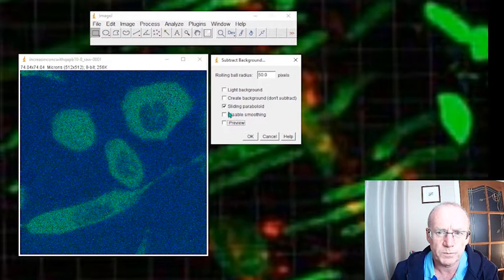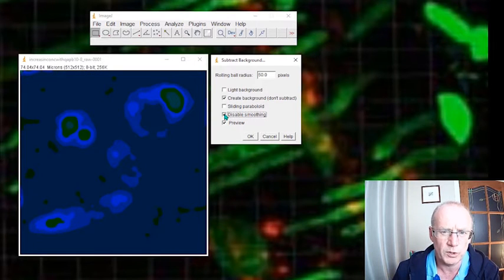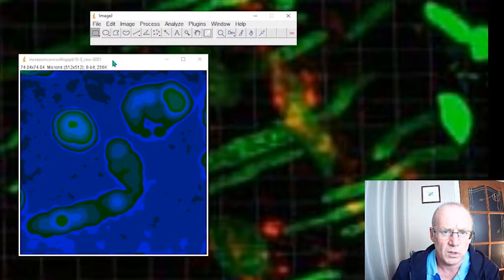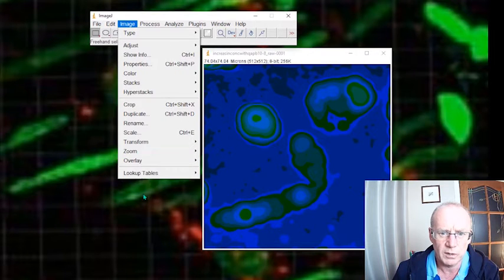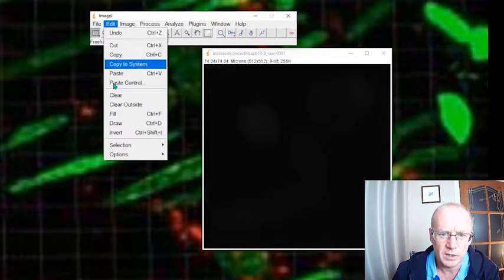So that's one option. What about actually using the background? Here, if we create the background, that's what the background actually looks like. We could do a little bit of smoothing on the background, but let's just go with that. So this is the background. Now, it looks a bit odd because of the lookup table, but if I go back to the grayscale lookup table, you'll see you can only just get a shadow, a hint of the cells there.